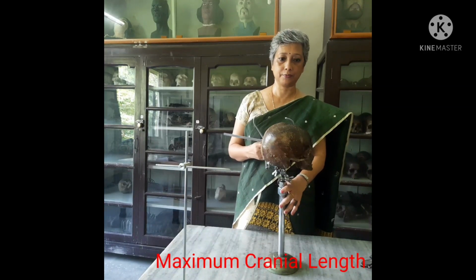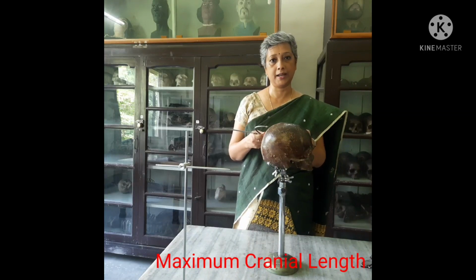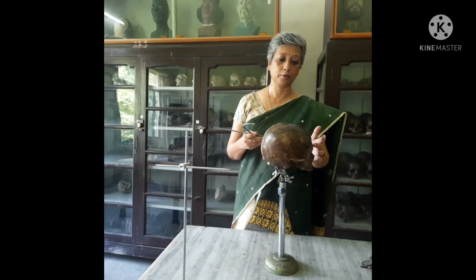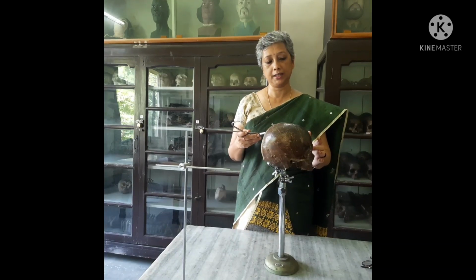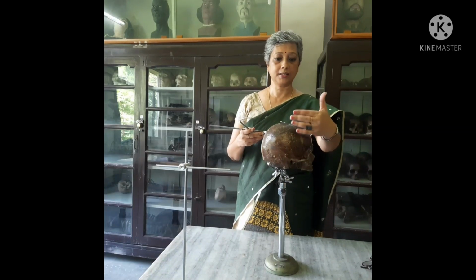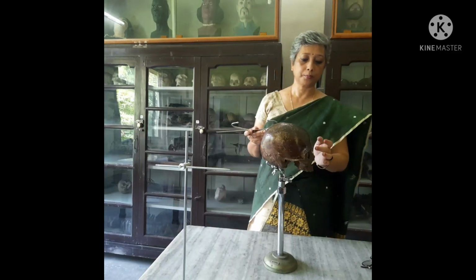For this, we first have to orient the skull on the Frankfurt horizontal plane and use the instrument spreading caliper. The maximum cranial length is taken from the landmarks glabella to opisthocranion. Glabella is the most prominent point between the two supraorbital ridges on the mid-sagittal plane. The mid-sagittal plane is the plane which divides the skull into two parts, the left and the right part.